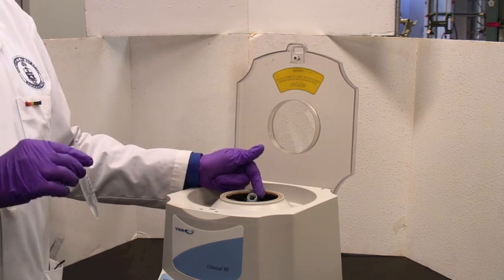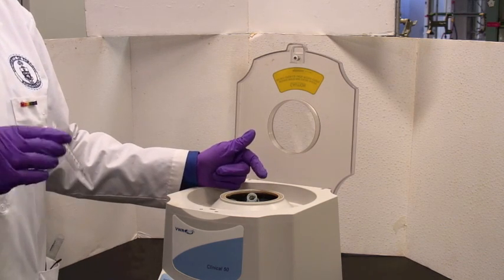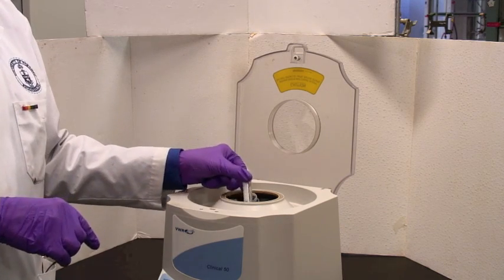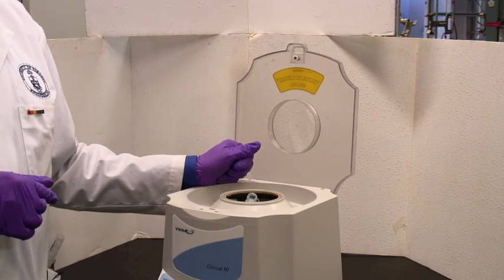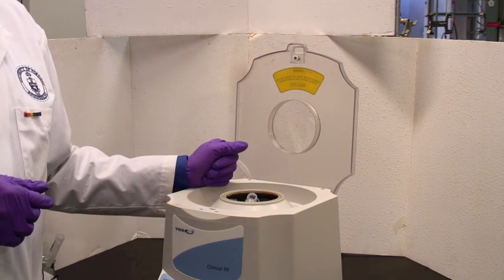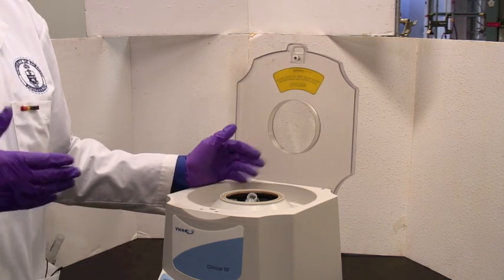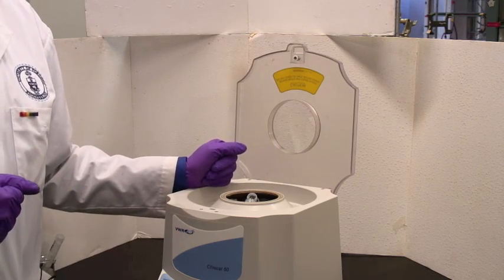If you have one of your own, by yourself, no one else, then just take a second centrifuge tube, put water in it to give you a reasonable balance, and then away you go and spin. Normally, there will be other people around you, and you can share the spin with other people.